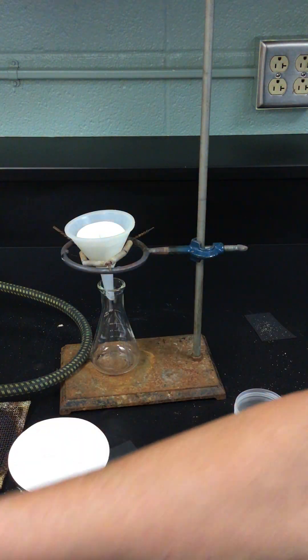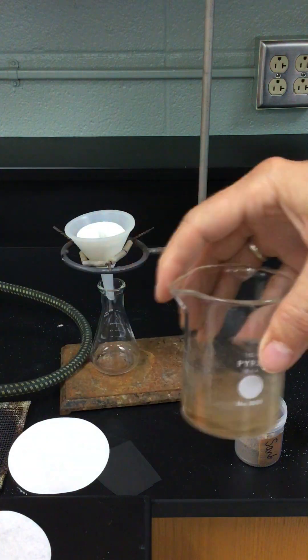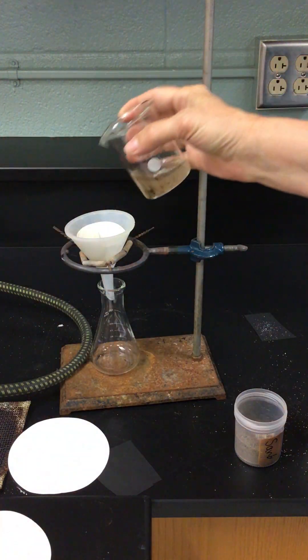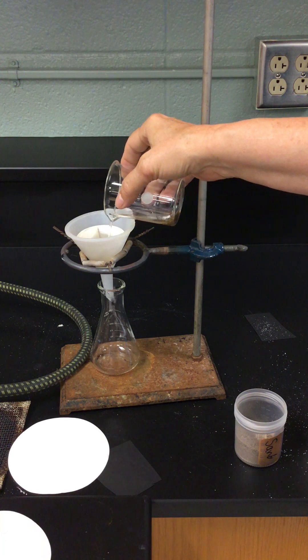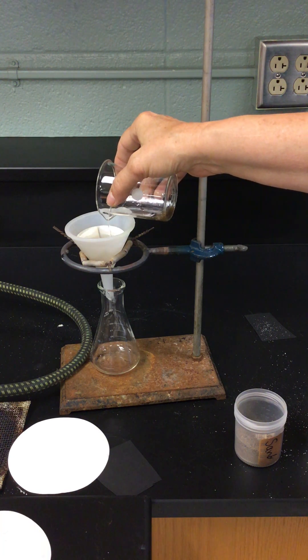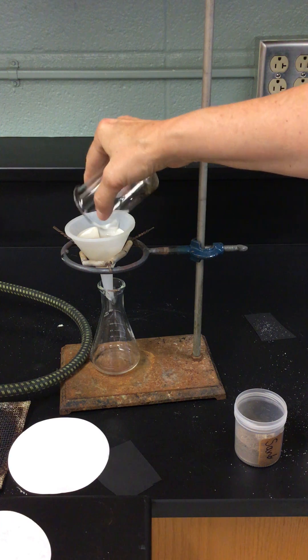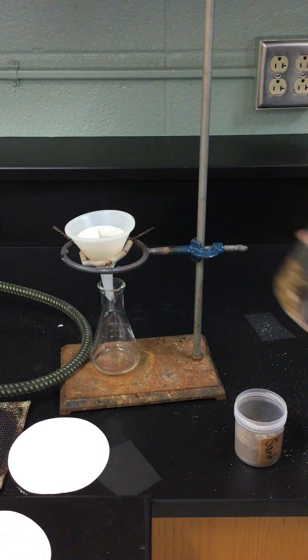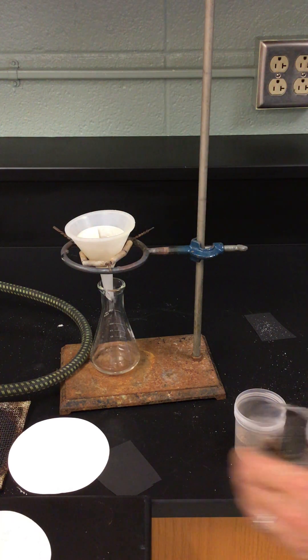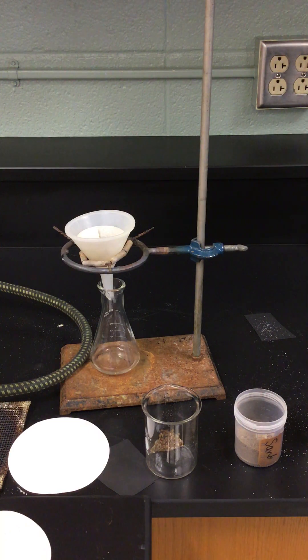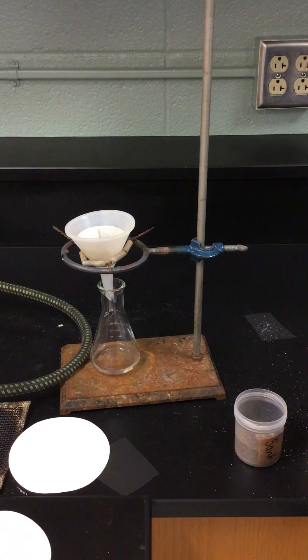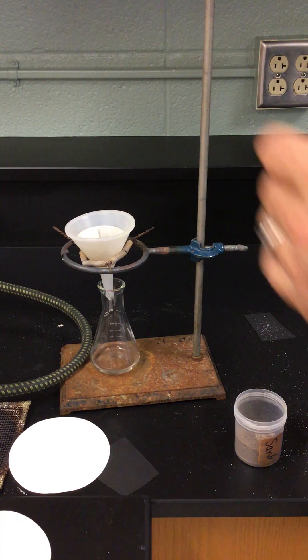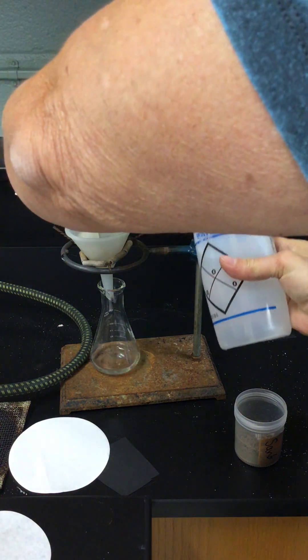Then I'm going to pour this into my filter. I probably won't let the whole thing filter because although my filter paper appears to be going pretty quickly, that's good. I'm going to have to sort of get in front of this because I'm at sort of an odd angle.